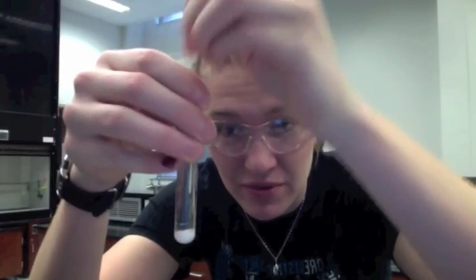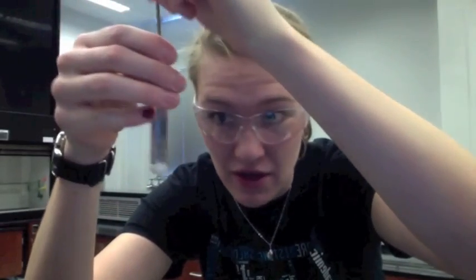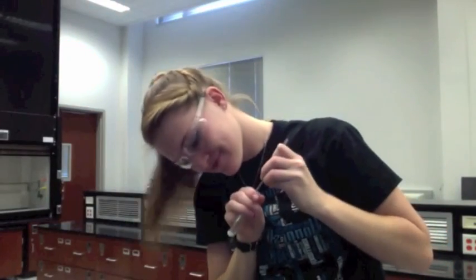When trying to dissolve the substances in water, make sure not to put too much of the solid in the test tube. This will result in a hard white clump at the bottom of the test tube that is hard to break up. Even though the substance might be soluble, it is hard to tell because of this large white clump of solid. You will have to break it up and it will take a long time.